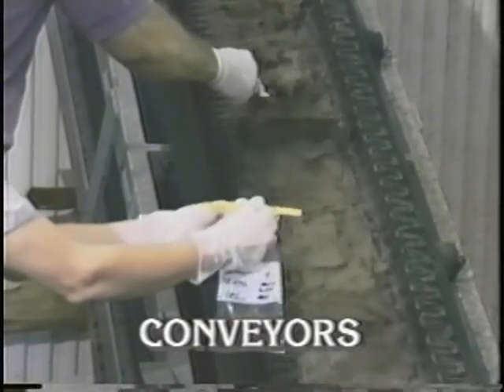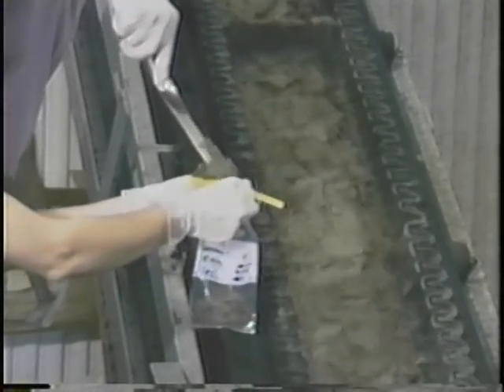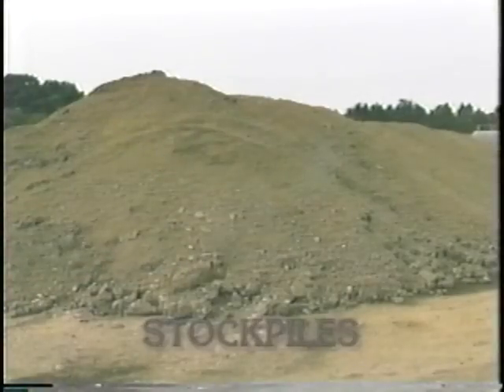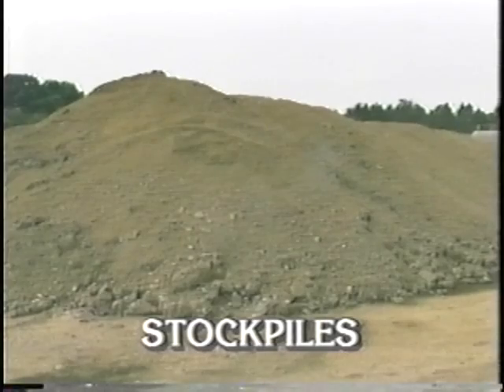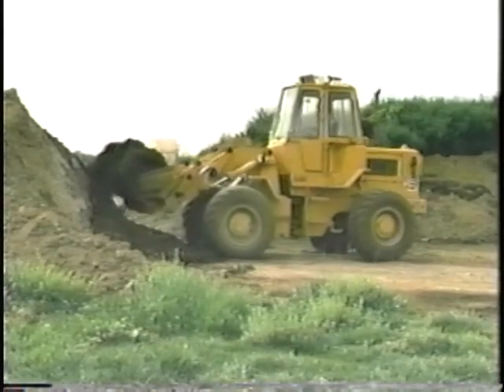The most appropriate sampling location is the last point prior to the sludge leaving the treatment plant. This is where the sample is representative of the sludge which is hauled off for final use or disposal. Consider safety and accessibility in identifying the sampling location.